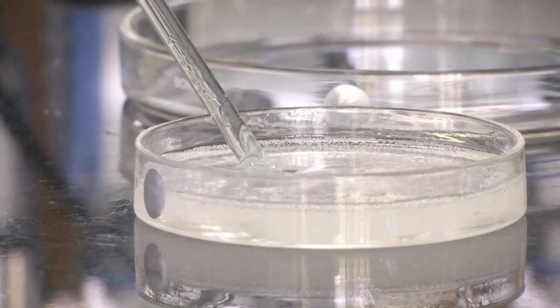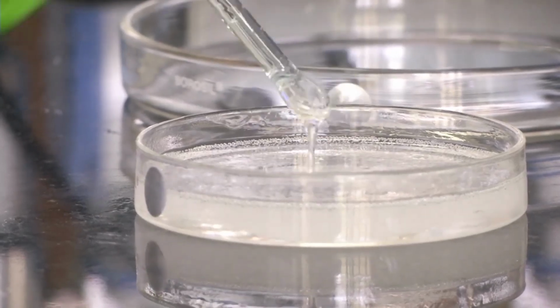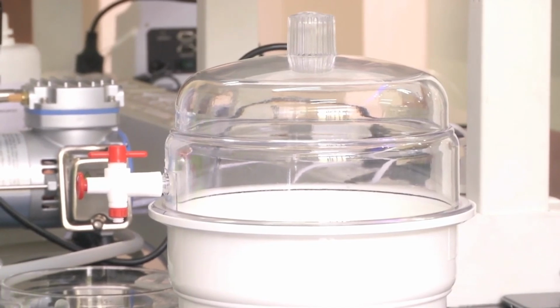So the next process is to remove the air bubbles from this mixture. How do we do that? We do that using a vacuum desiccator and a vacuum pump. We have already seen in prior modules how the vacuum desiccator and the vacuum pump are used. Now we will see the actual practical application of it.